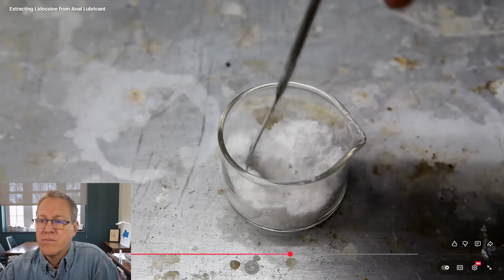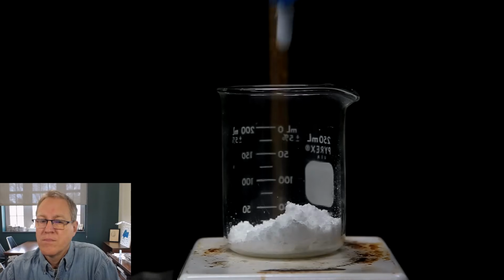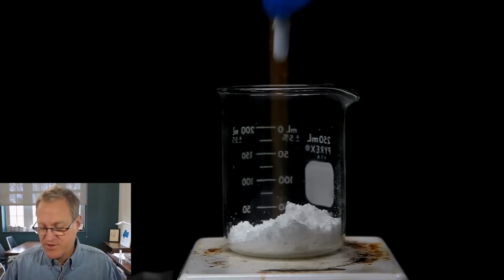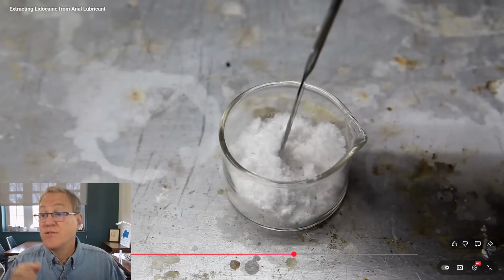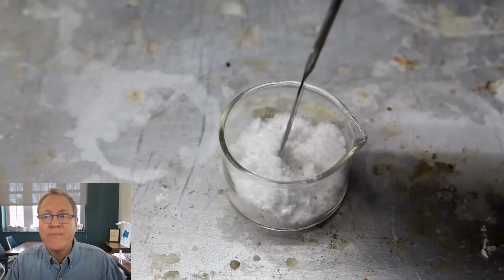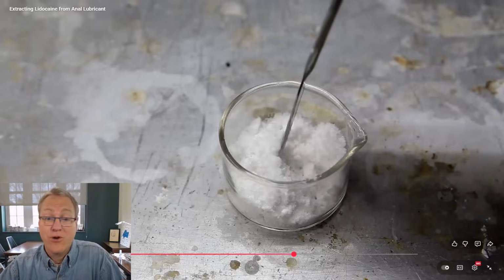So now we have some free-flowing lidocaine freebase, and it looks pretty clean, but actually looks can kind of be deceiving. Okay, let's pop back on that a little bit. More frames. To me, it does look good. And he doesn't say this, but I suspect he maybe tried to carry this ahead and found he ran into problems. So somehow he figured out that this is not good enough, even though, by my eye, it looks great. And he even said it looks good. So somehow he did some searching to figure out how to make this even better.